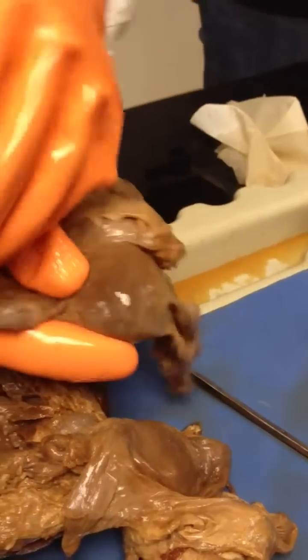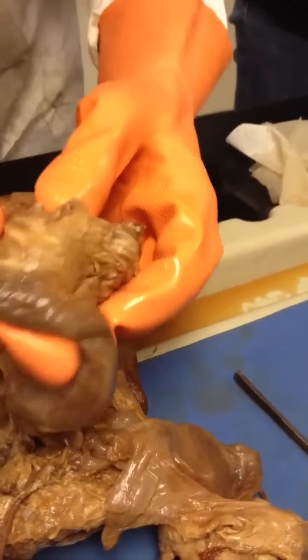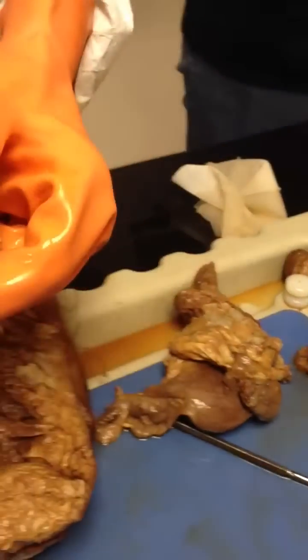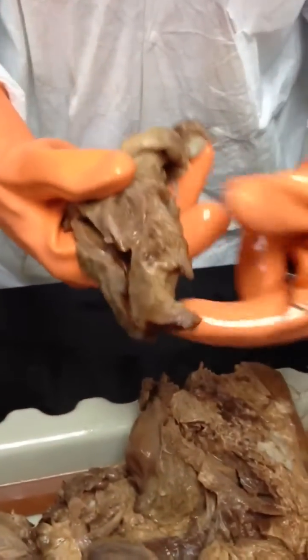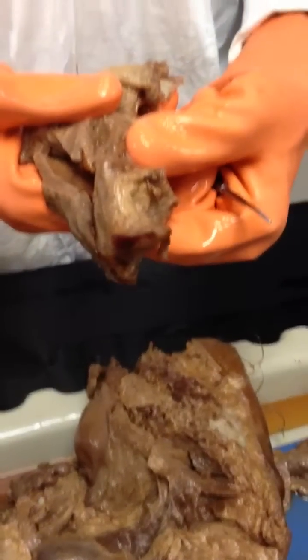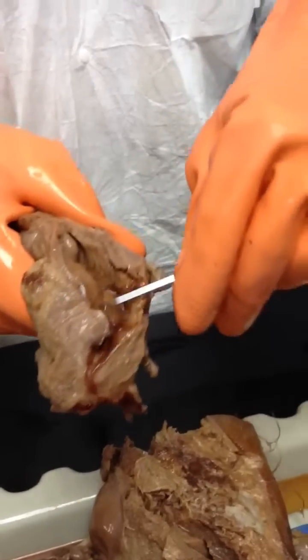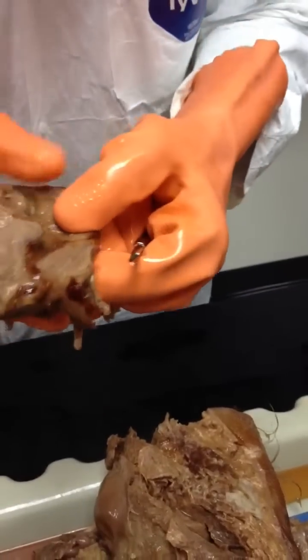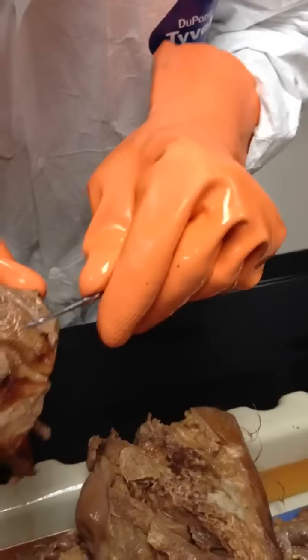Okay, so now let's take a look at this. One of these has something else. They have something else exposed in one of these, and it's this one. Okay, so here, enclosed within this connective tissue is the vagina. So I incised the vagina on one side. I opened up the vagina. Okay? And then there you can see the lining of the vagina.